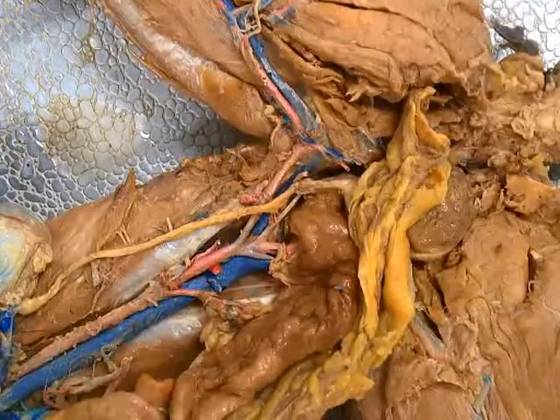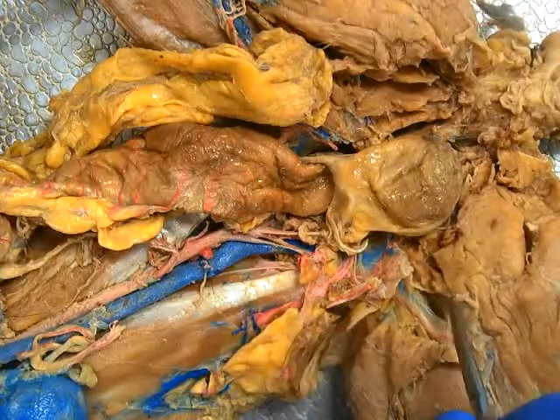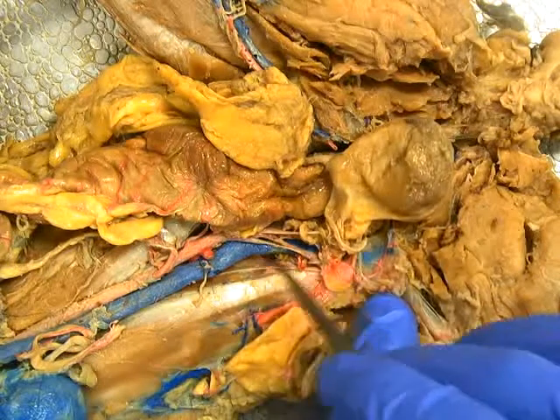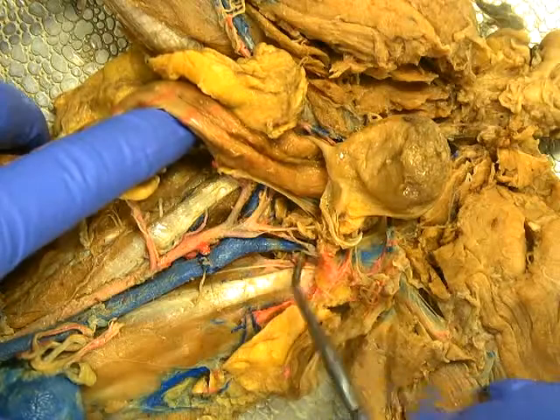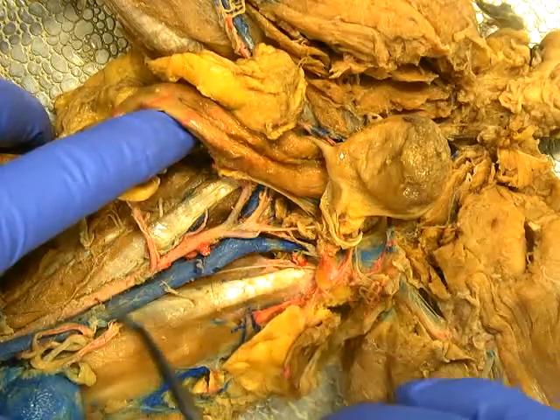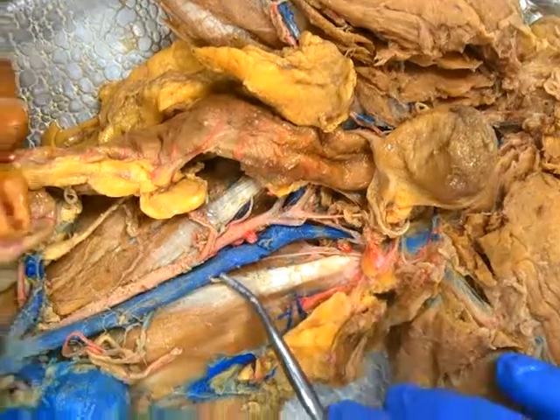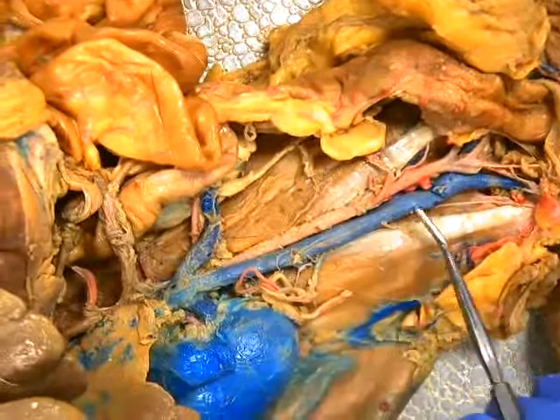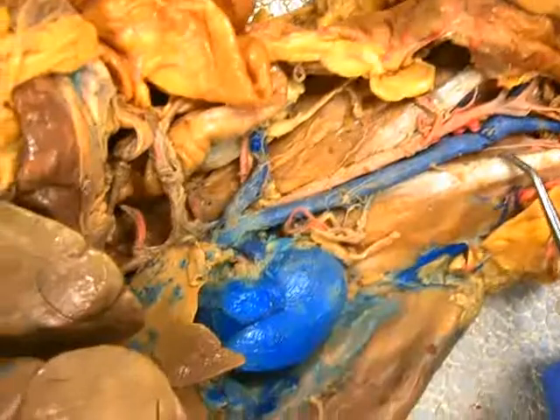Coming back up, the great saphenous vein will be tested from the model also. We'll see here the right femoral vein and left femoral vein on the other side. These two are going to go into the pelvic cavity and enter the right and left common iliac veins, which will both dump into the inferior vena cava. We don't see the inferior mesenteric or superior mesenteric veins and won't test on those, but you'll need to know that anything coming from the intestines has to go through the liver to be processed — those are your nutrients.